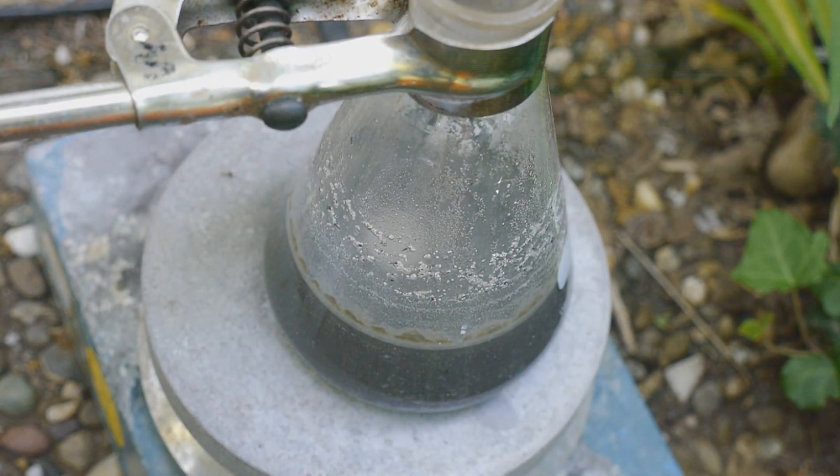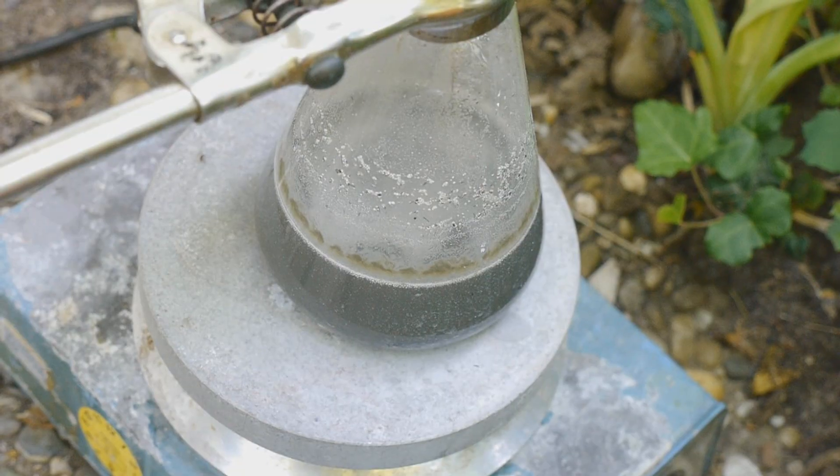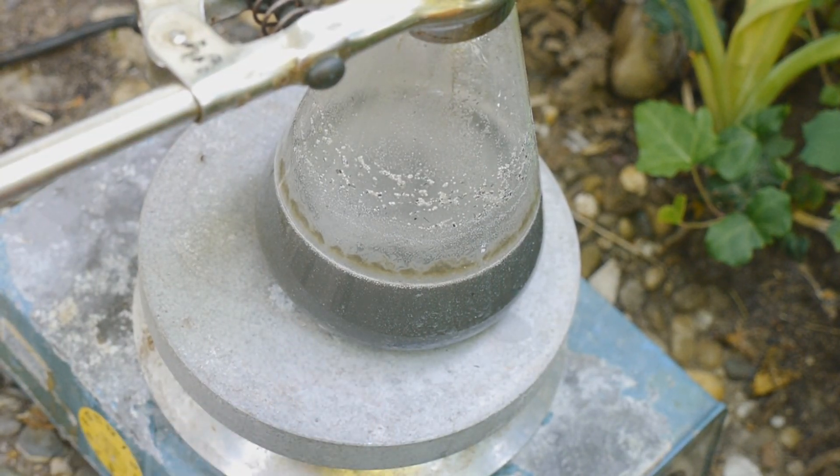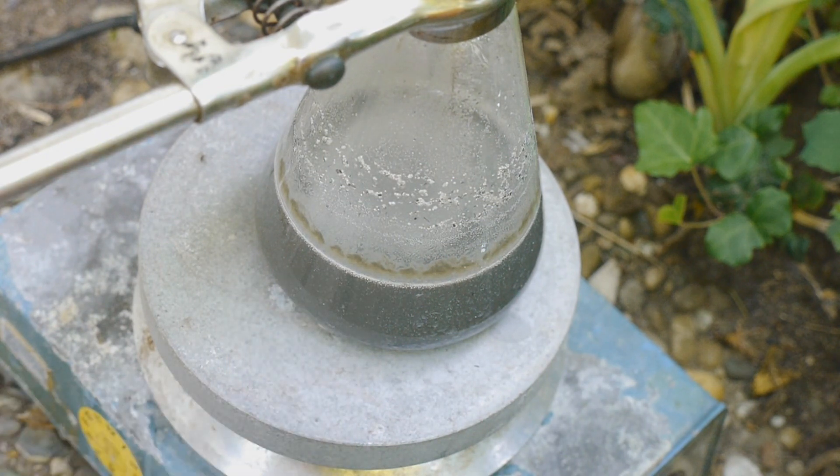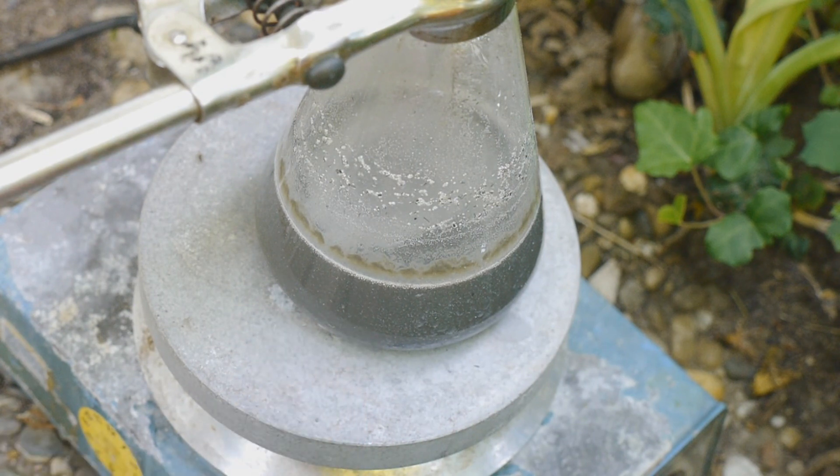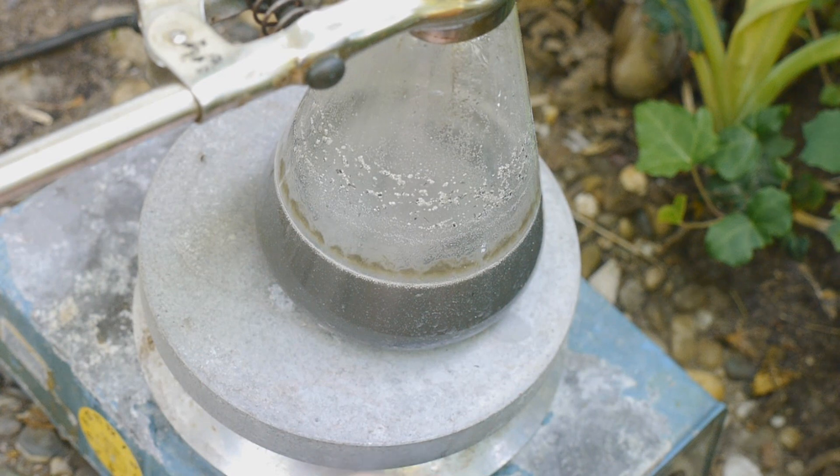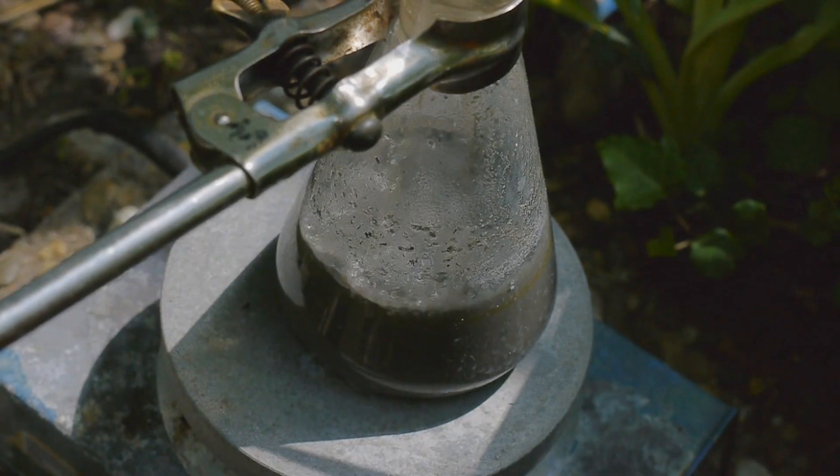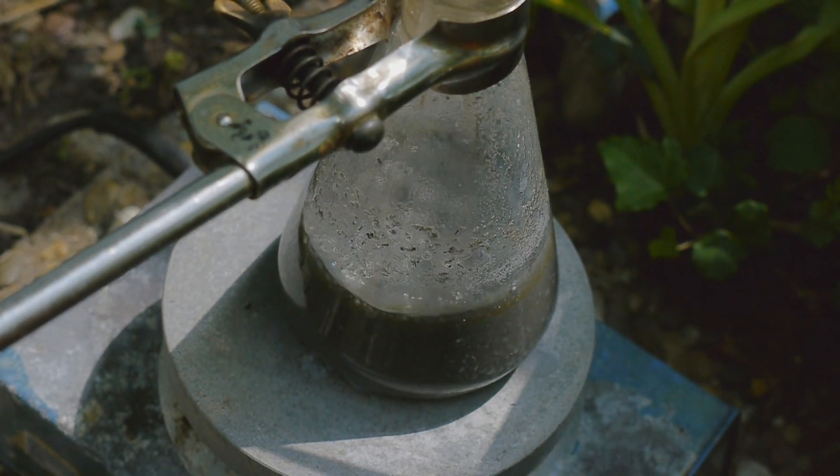Well at least there seems to be some sodium collected on the surface, but not nearly as much as I would expect or like. So we have actually collected quite a lot of sodium on the surface, but it's not coalesced. So apparently this method just needs to boil for a long time. So we'll turn the heat back on and we'll see maybe we'll get some nice lumps of sodium. This has been refluxing now for a couple of hours. So let's turn it off and hope we get something of use.